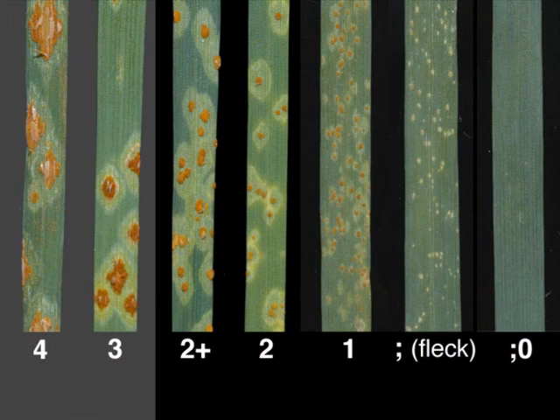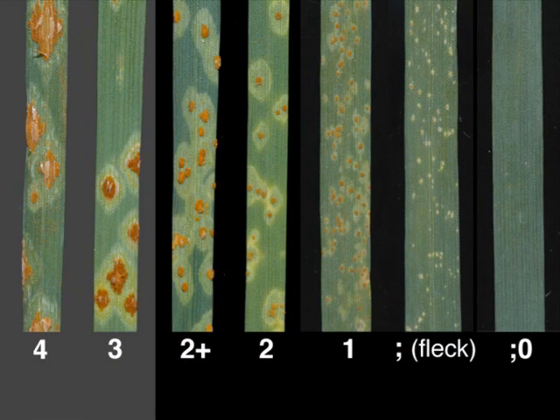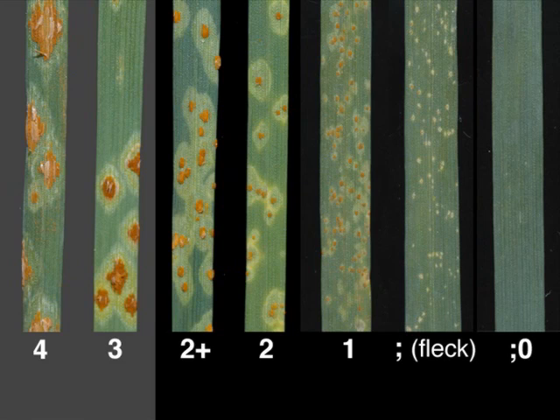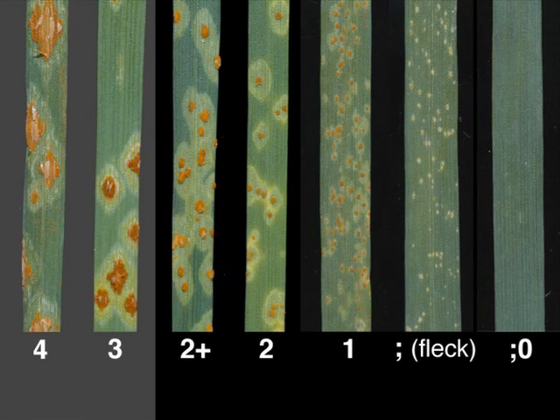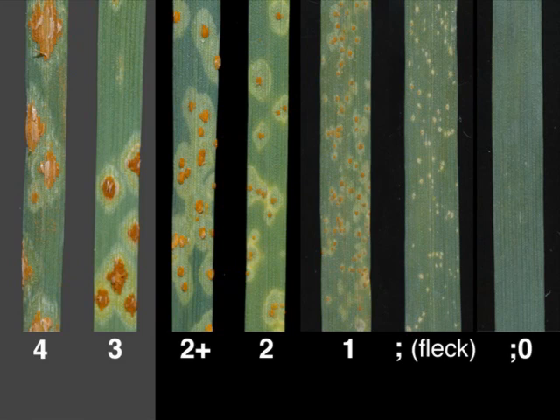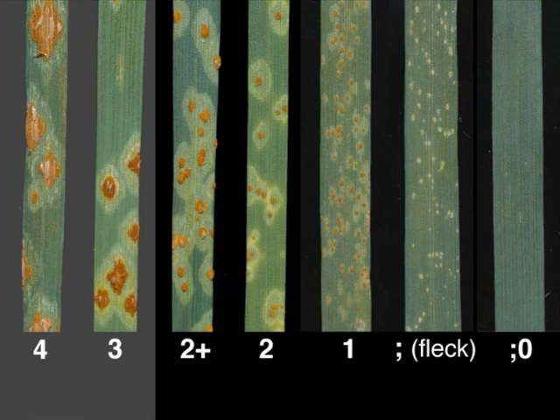Infection types are classified on a zero to four scale, where zero is an immune reaction with no rust and four is complete compatibility.